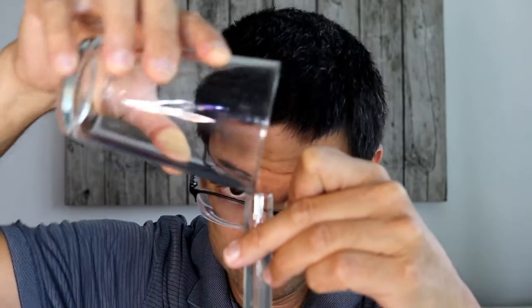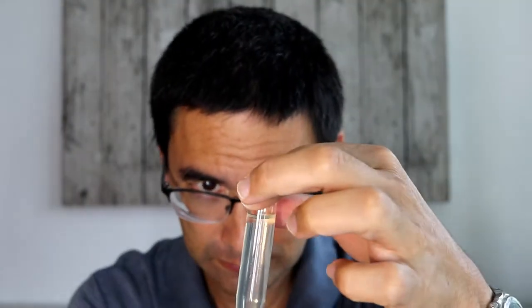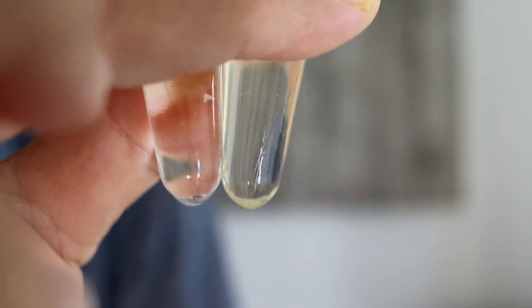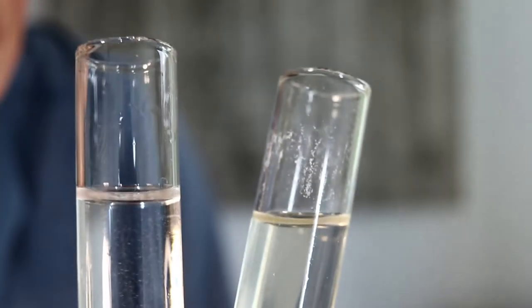I'm spilling a little bit, but it's okay because I still have enough of the solution left. And then I need to make a counterweight and I'm just using pure water for the counterweight.